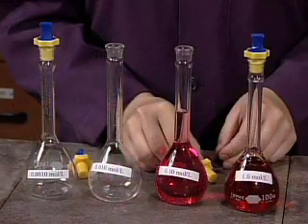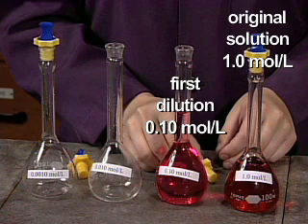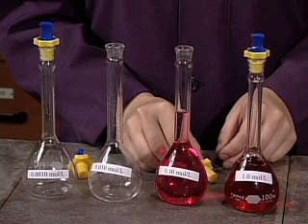The first dilution yields a solution 1/10 as concentrated as the original. Since 1/10 of the original solution is now in 10 times the volume of solvent, the concentration of the diluted solution will be 1/10 of the original.